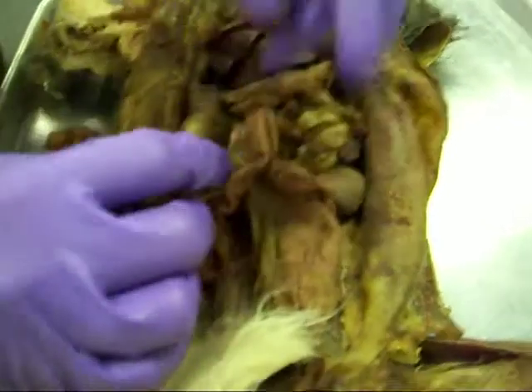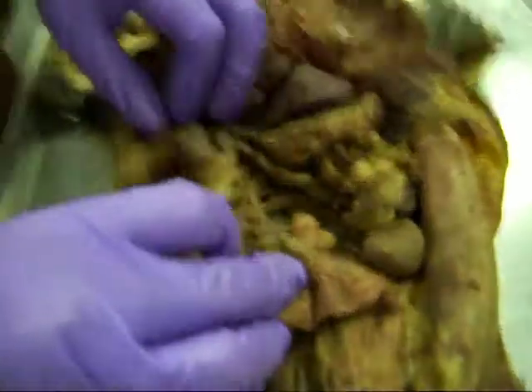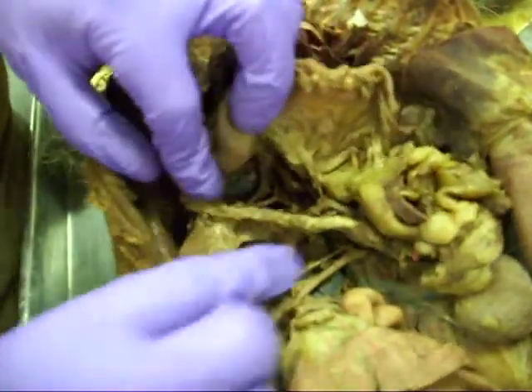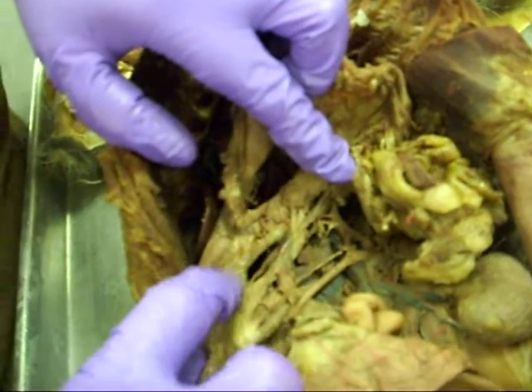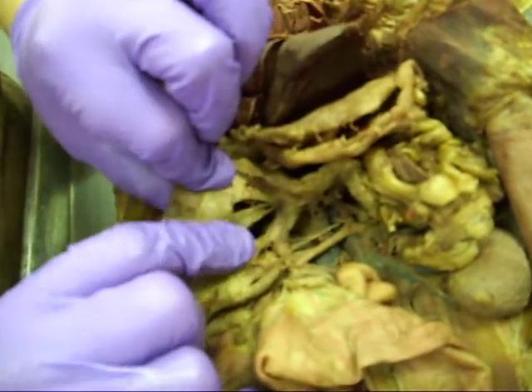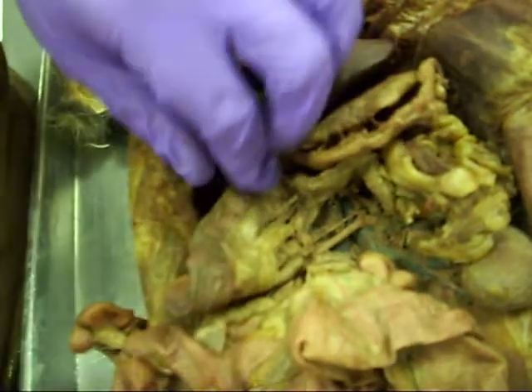The mesoduodenum — that's where the pancreas is. You have the duodenum here and you have that pancreas kind of in a mesentery down through here, so this is the mesoduodenum. We had to rip it away to see a lot of our veins.